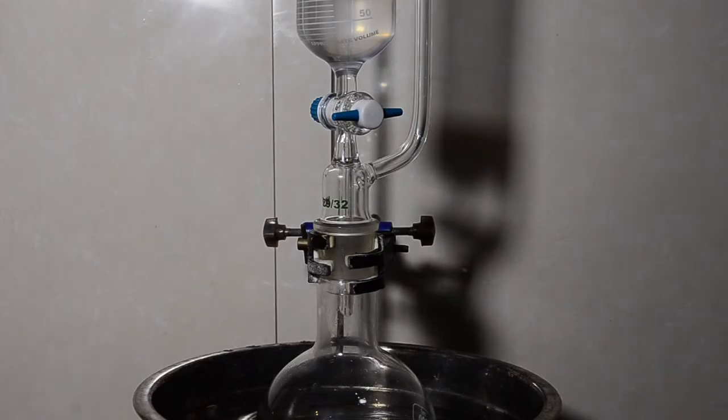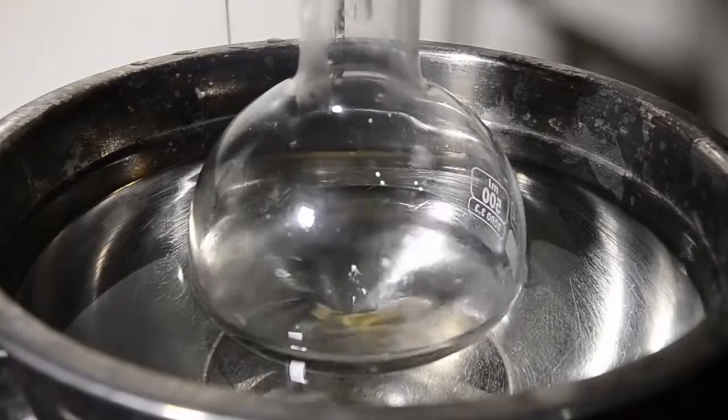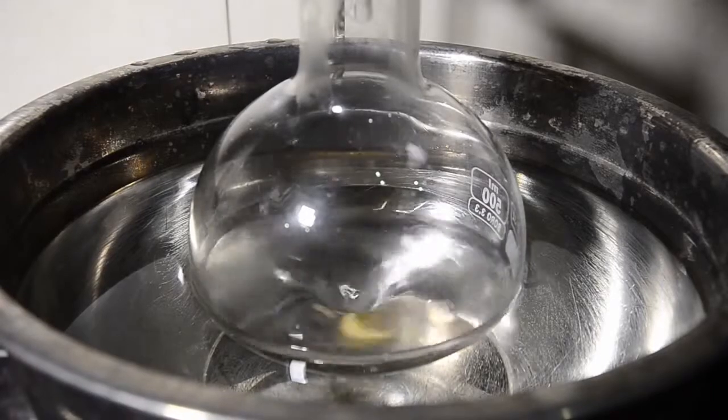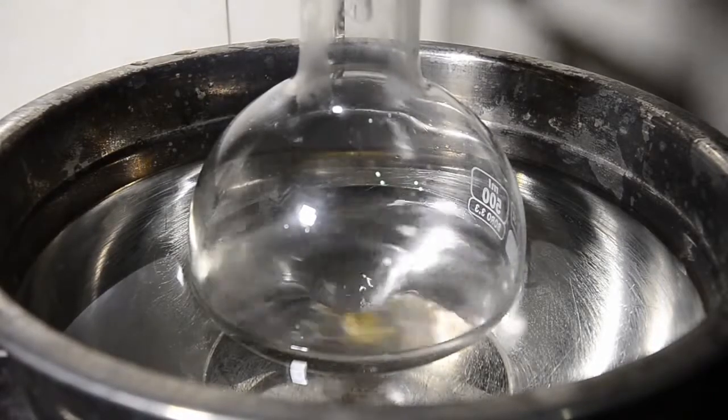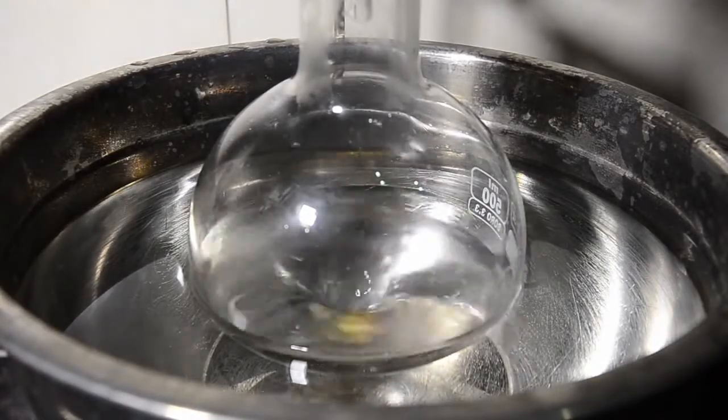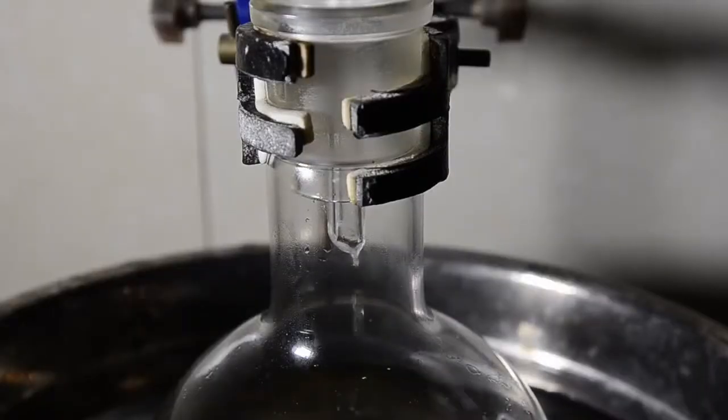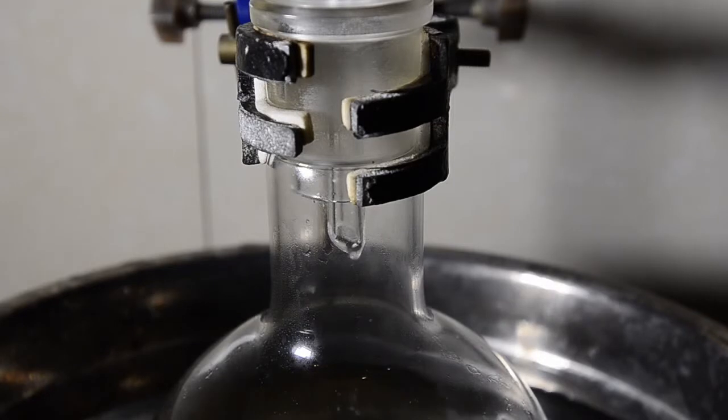Try to minimize the opening to the atmosphere. With the water bath at room temperature and with stirring, start to add the phosphorus trichloride. You shouldn't see much of a temperature increase but add carefully just to be on the safe side. Our addition here took 20 minutes to complete.